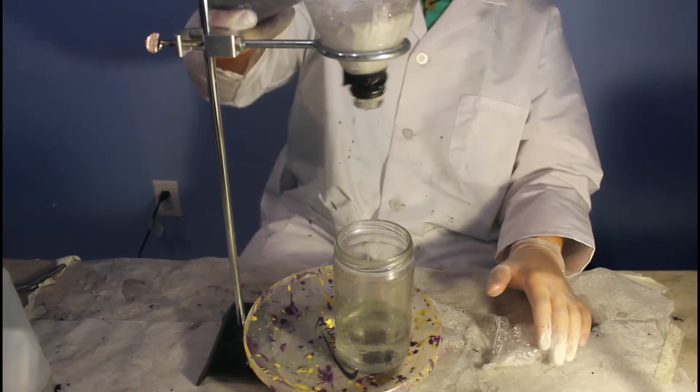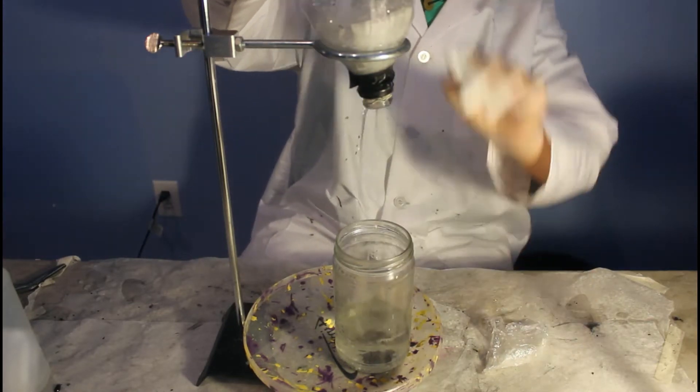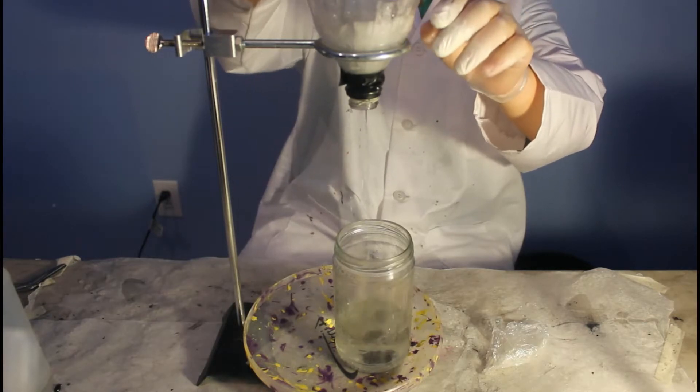It is immediately decanted into the funnel. While the zinc is filtering out, the flask is refilled with deionized water, shaken and filtered again.